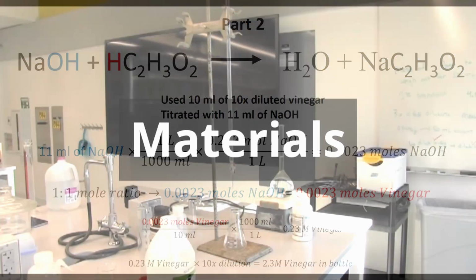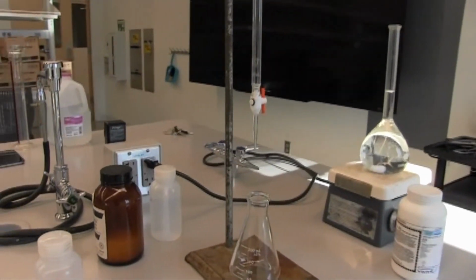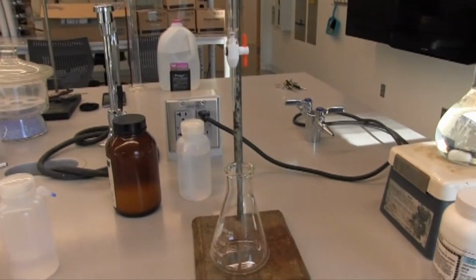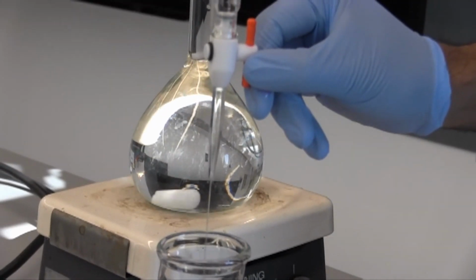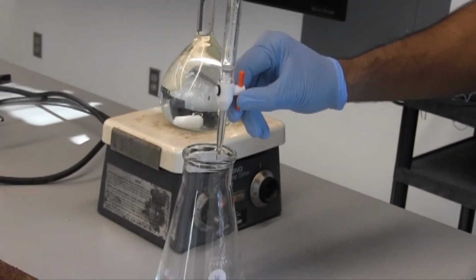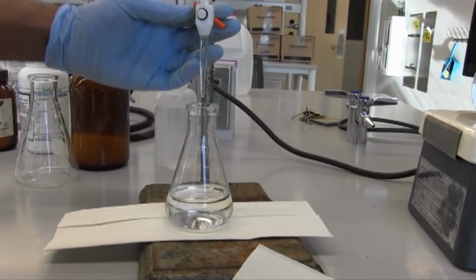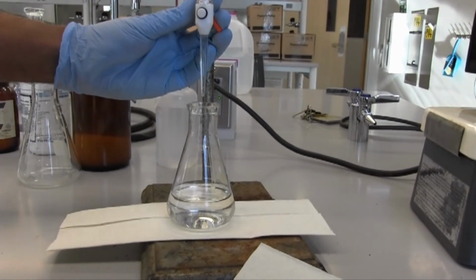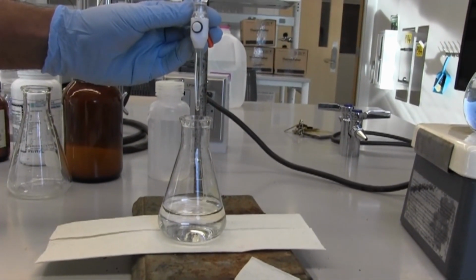So in this lab, we have several materials that we'll be using. We're going to start off by looking at our burette and our burette stand. A burette is just there to hold liquid and allow us to drop a liquid bit by bit into a container. The container is going to be our Erlenmeyer flask, as you can see here. The shape of the Erlenmeyer flasks allows us to minimize spillage and splashing when we drip the drops from the burette into the Erlenmeyer flask.